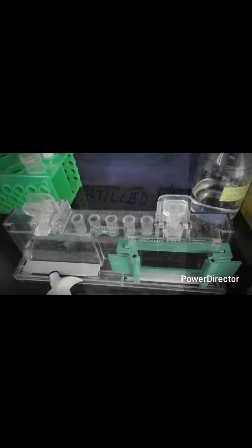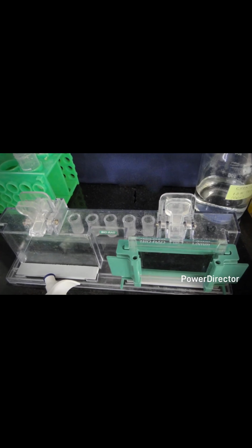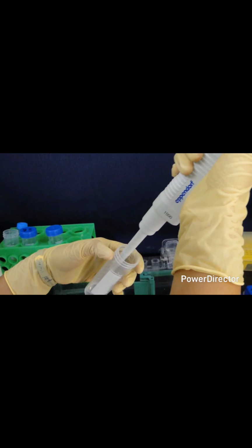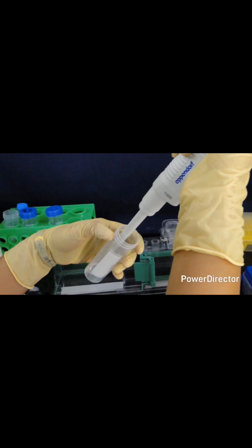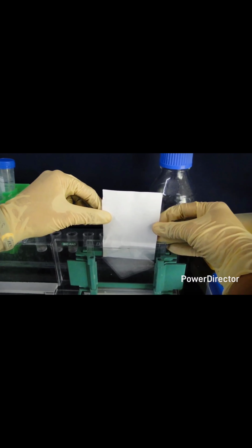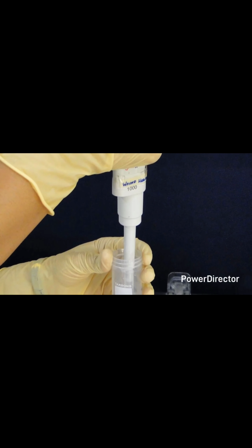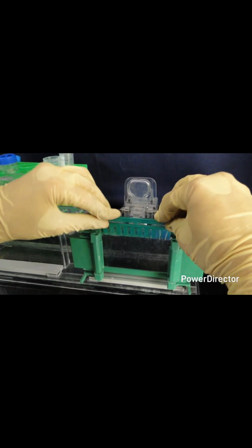Prepare the stacking gel monomer solution by combining all reagents except the APS and the TEMED. Drain the isopropanol with strips of filter paper and blotting paper. Add the APS and TEMED to the monomer solution just before pouring it in between the slides and mix well by swirling gently. Place a comb in the stacking gel sandwich and allow it to polymerize for 10 minutes.